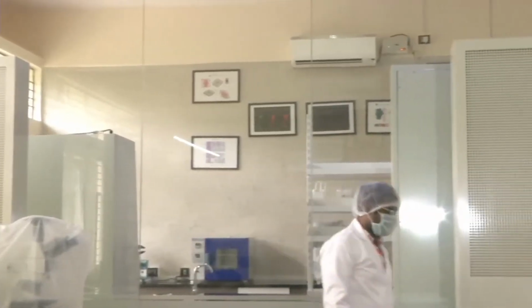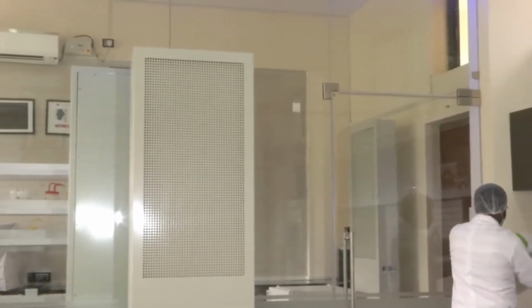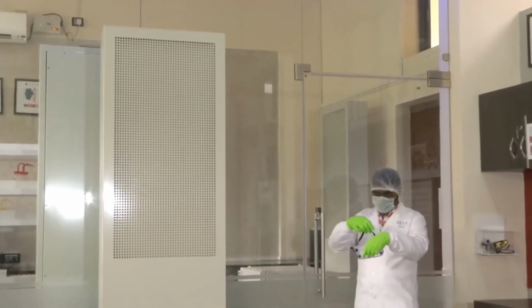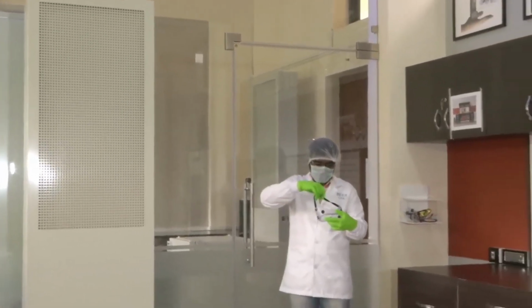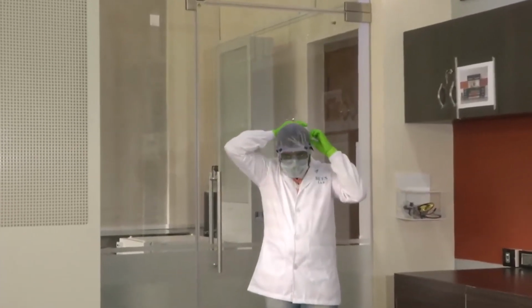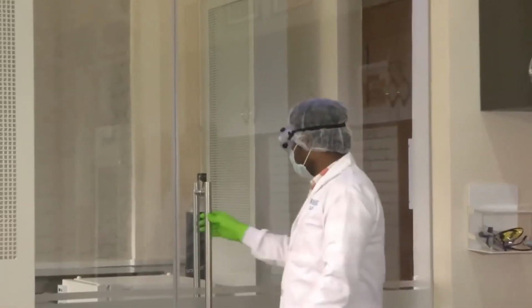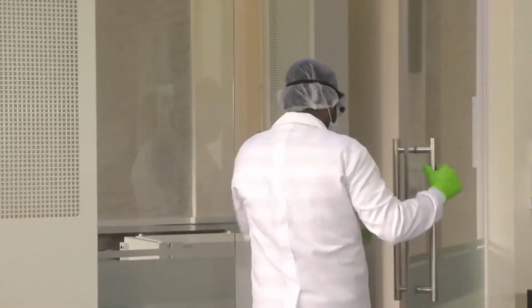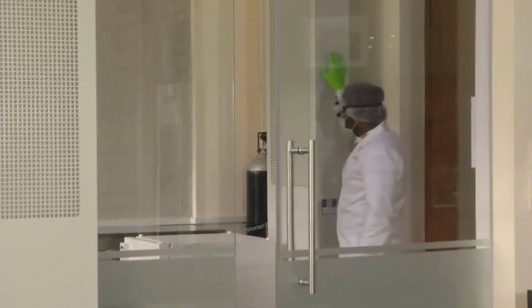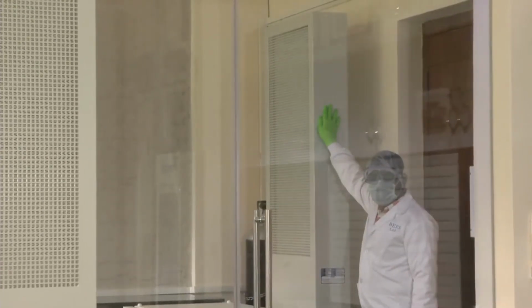Now we have another partition, as you can see inside, where we do biological testing with our sensors. Before we enter that, we have to wear goggles, as we have introduced before. So Sitaram will wear the goggles and go inside and show you another tower module that is kept inside the lab. He has worn the goggles. Now he will enter the next section in the lab, and there is another tower module that is kept inside the lab. These tower modules are used for circulating the air.